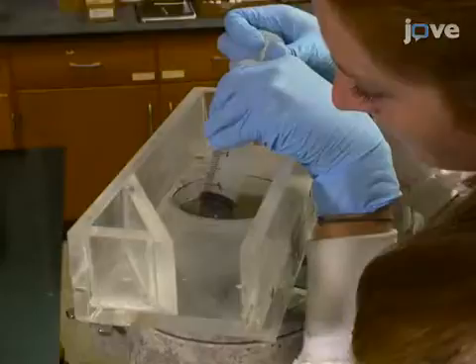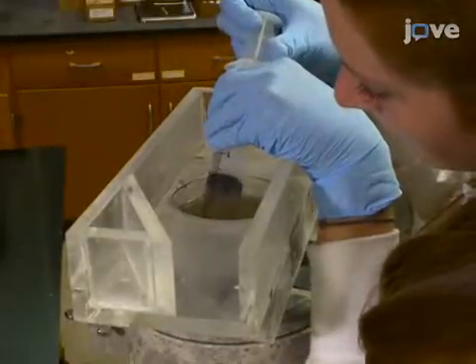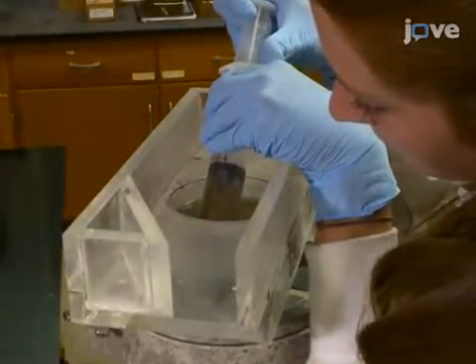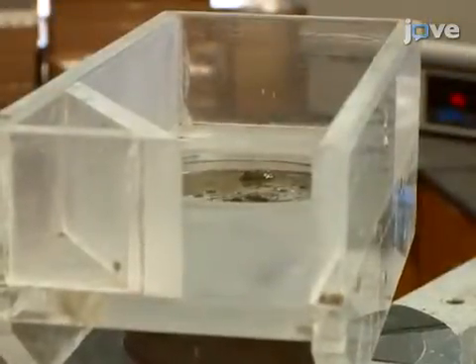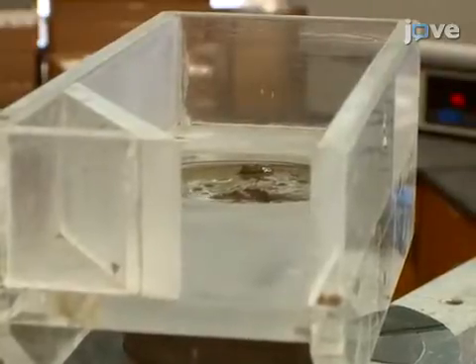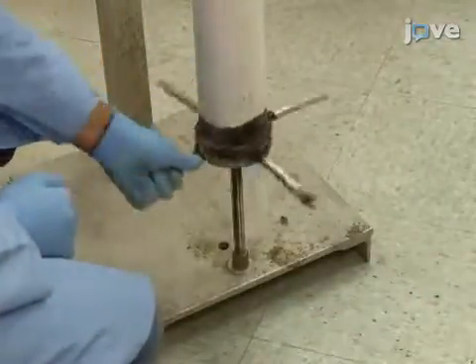Proceed by removing the water above the sediment by aspiration. Keep a sample if desired. Next, turn the piston to align the surface of the sediment with the surface of the sampling collar. Now set the sample size.